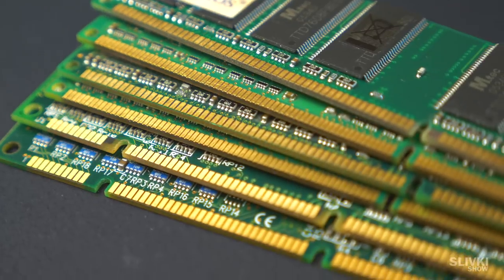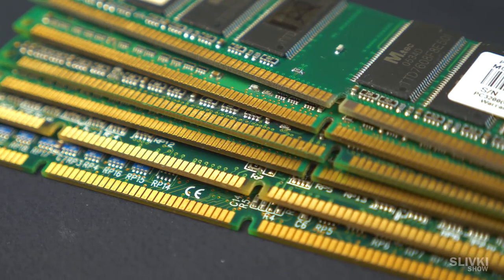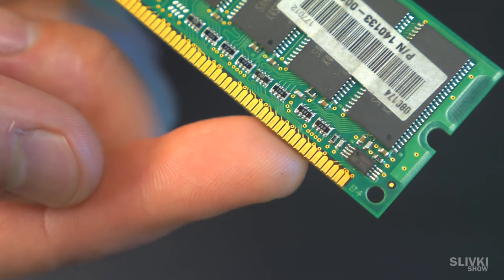This is RAM from old computers. And you know what it has? All these contacts are covered with gold.